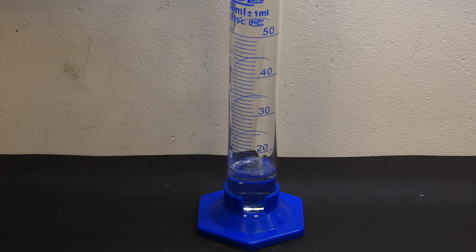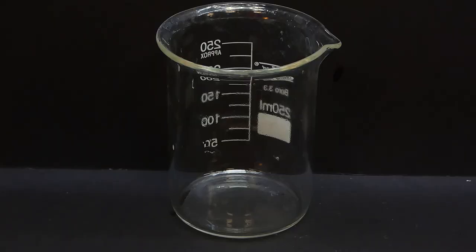To prepare the garden, we first need to dilute 25ml of the concentrated solution with around 200ml of distilled water.